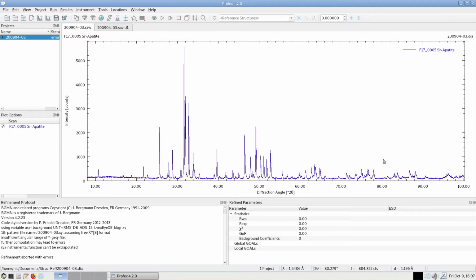Because in this range, Profex does not know the shape of the peaks, it refuses to run, and instead it issues this error message that the angular range in the instrument GEQ file is not sufficient.